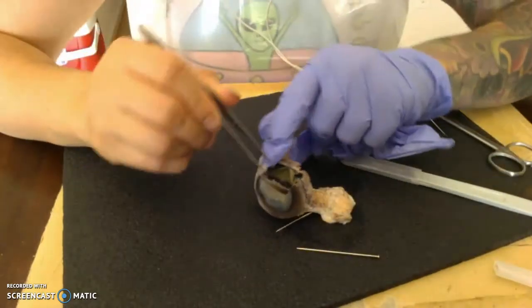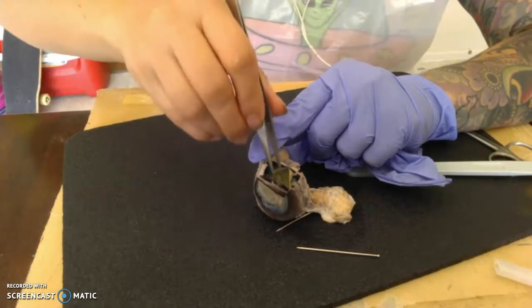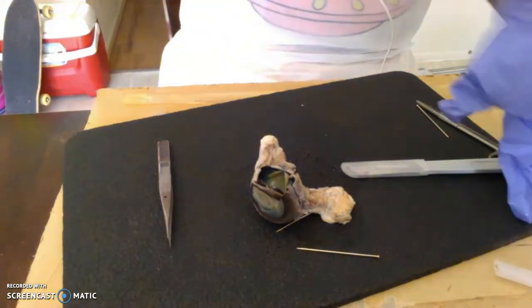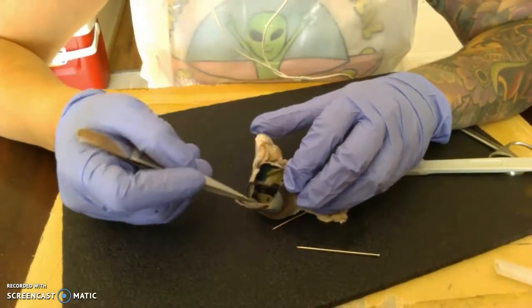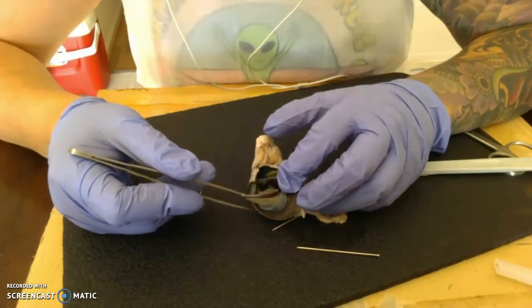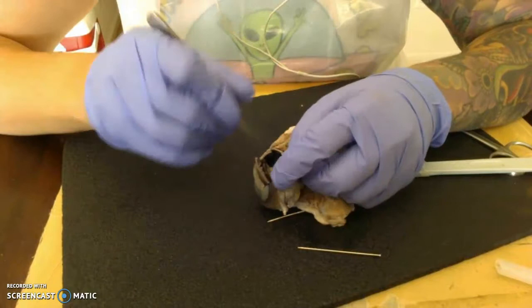So then as we pull that back, you can see this larger structure right here. I didn't actually take it out. It's just the lens. So let me put my glove back on. And then additionally, this is going to be our anterior cavity, which would be facilitating our aqueous humor. You didn't really see it with this for preservation reasons. But now we can go ahead and open it up.